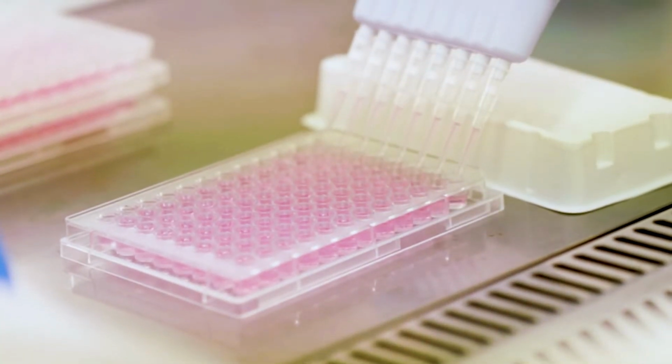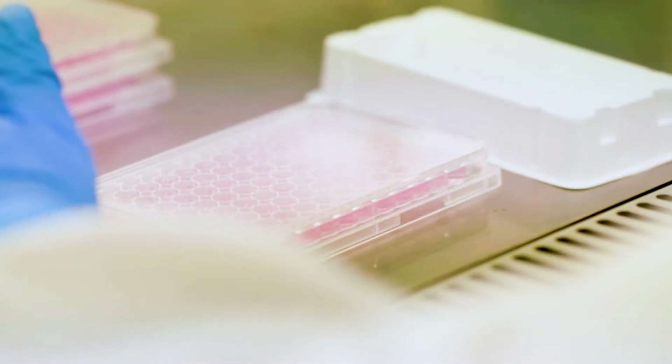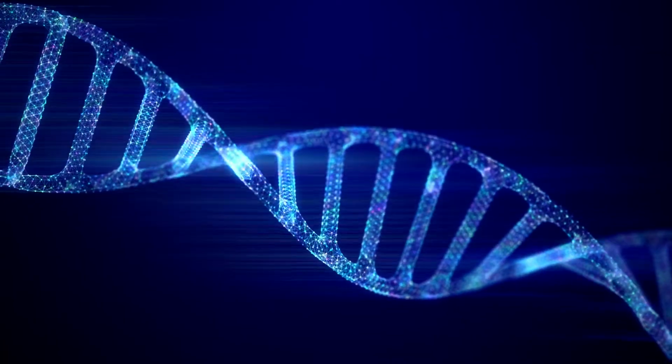So the enterovirus whole genome sequencing is in the development phase, and that's where we're having to now try to use new methods. And this is where the fundraising that is being done for this work is so important, that it will allow us to transition from the traditional virus culture to whole genome sequencing.